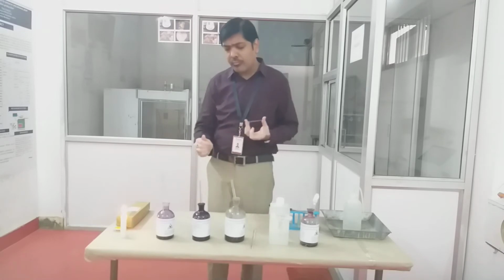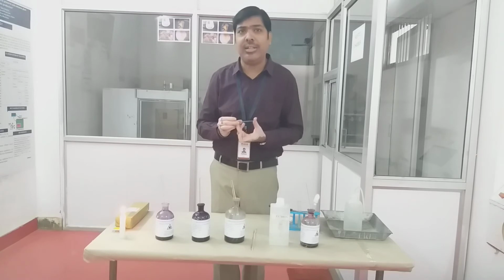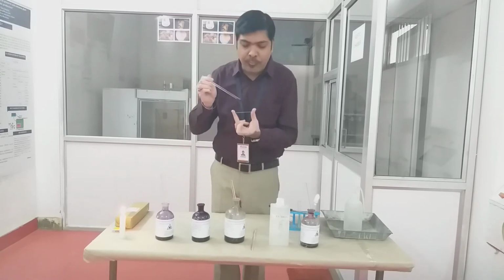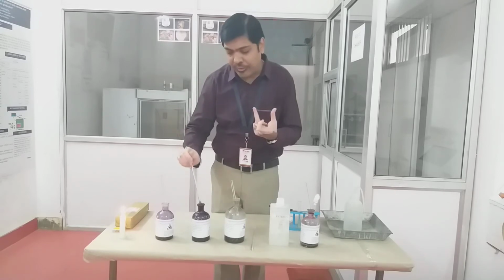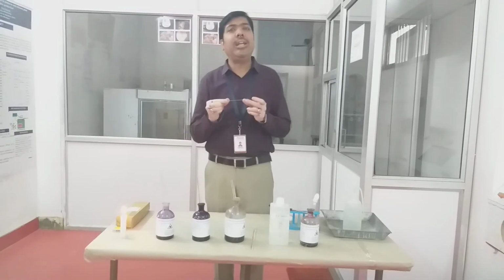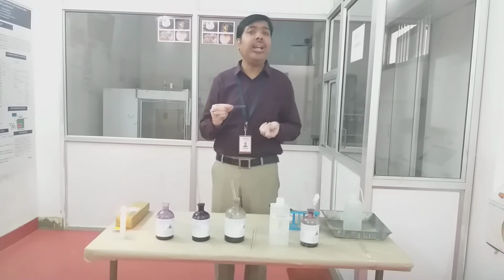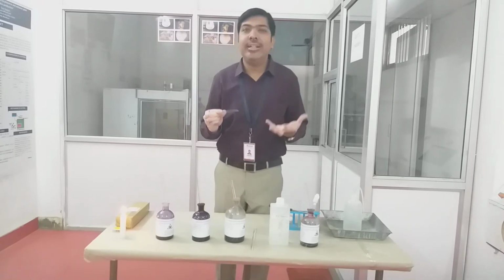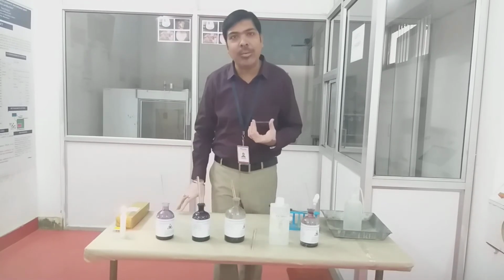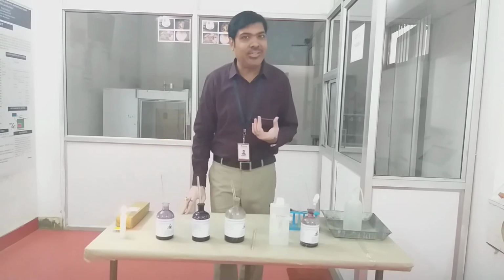Okay. So the first stain that we need to use in Gram staining is crystal violet. First we'll take the crystal violet dye and put it on the surface of the smear, like this. And again we have to wait for some time, approximately 1 minute. Here the crystal violet acts as the primary stain, so whatever microorganisms are available in our sample will be stained violet because of the presence of the dye, crystal violet.